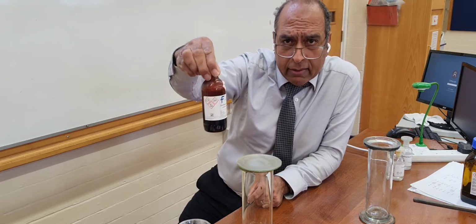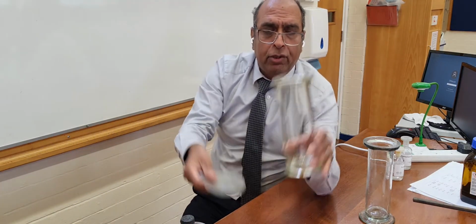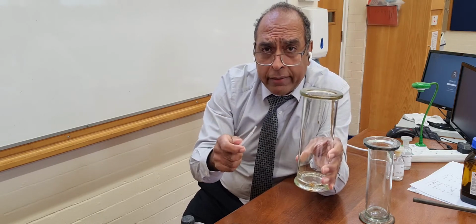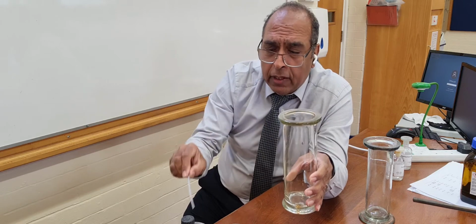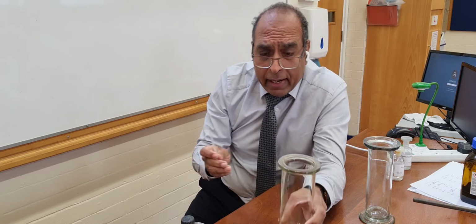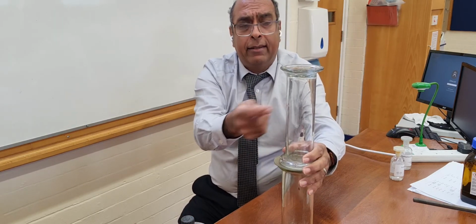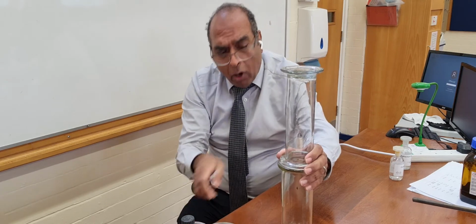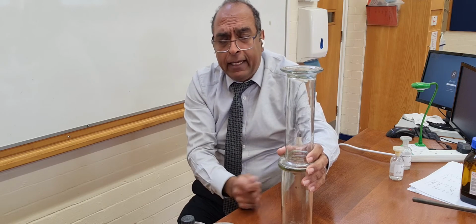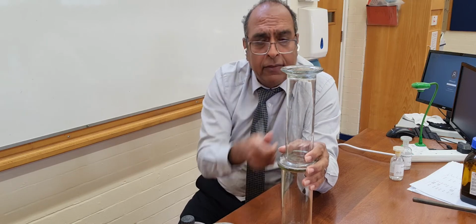Bromine is a red liquid, and what I'm going to do is to take a drop and put it in here. Now, bromine is a red liquid, but it's very volatile, so it will turn into a brown gas. We should be able to visually see the brownness. Then, if I put this air gas jar over the top, I'm hoping we can see the brown gas spreading from the bottom jar to the top jar, even though bromine is a much, much heavier, more dense gas than the air.